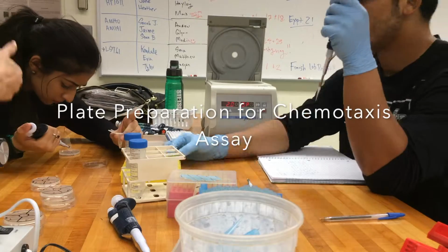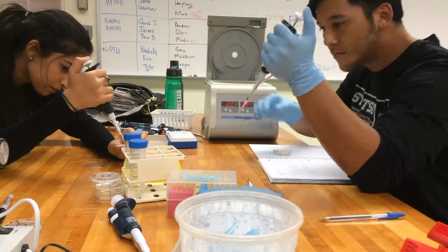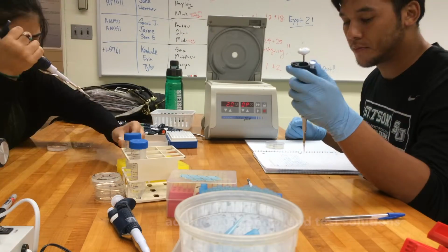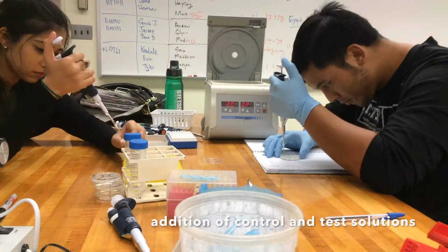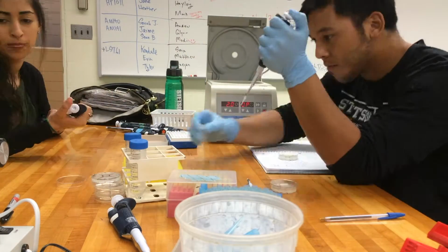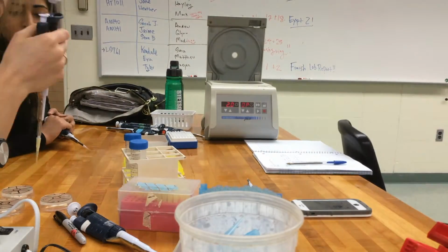6 chemotaxis plates were prepared with approximately 25 to 100 worms pipetted into the origin of each plate. Immediately after, 2 microliters of the test solution, which contained 0.5% diacetyl, 25 millimolar sodium azide, and ethanol, and the control solution were placed into their appropriate quadrants.